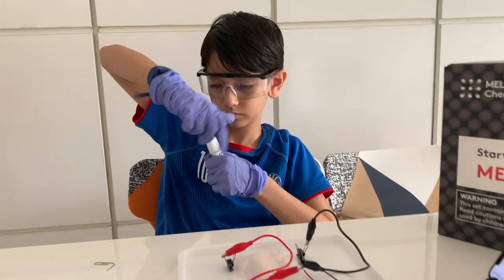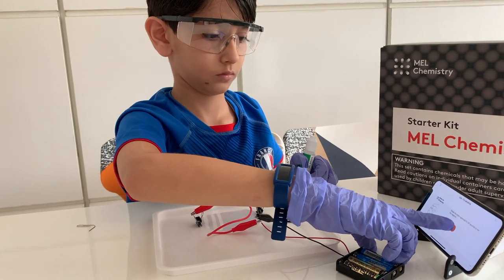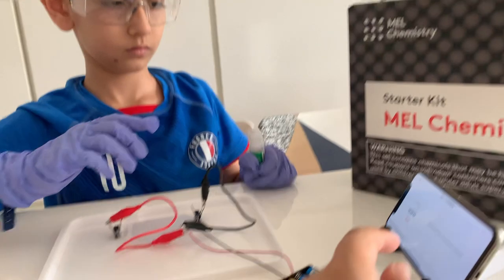And it's shaking time once again, with a timer of 30 seconds. Ha haa. Silly glove. Okay!